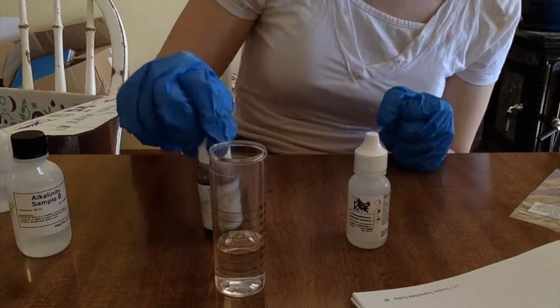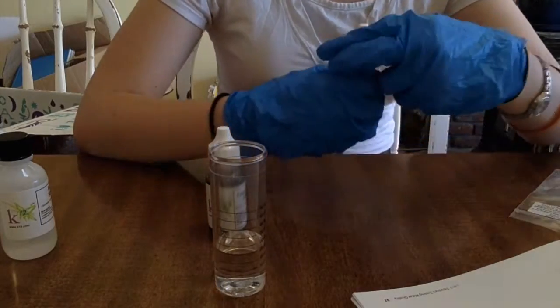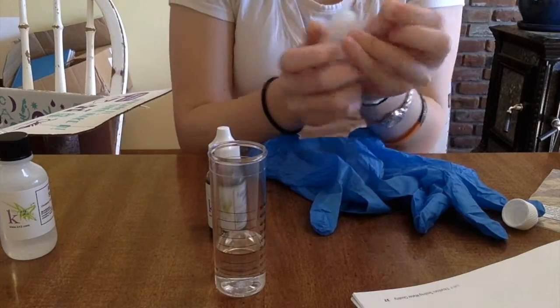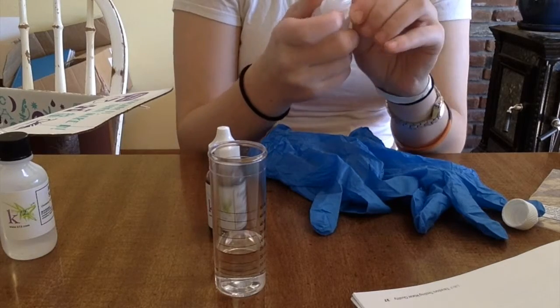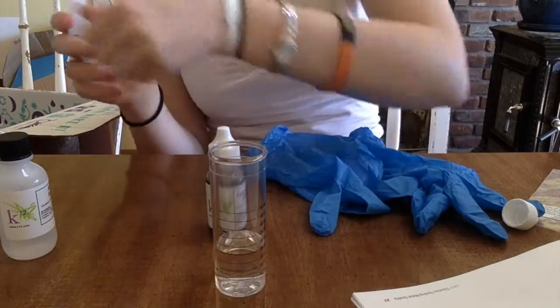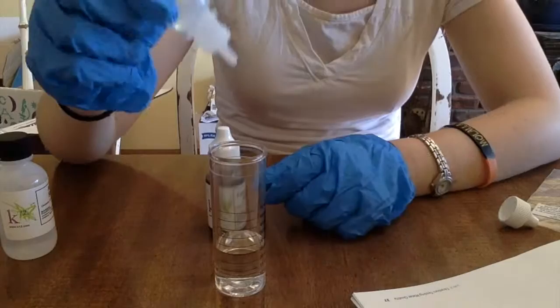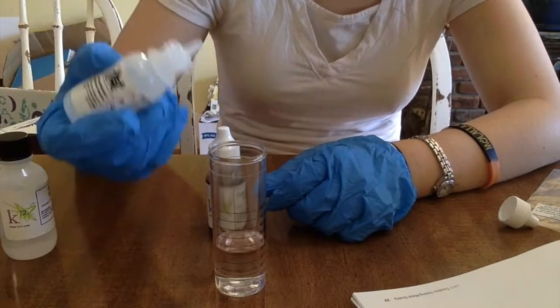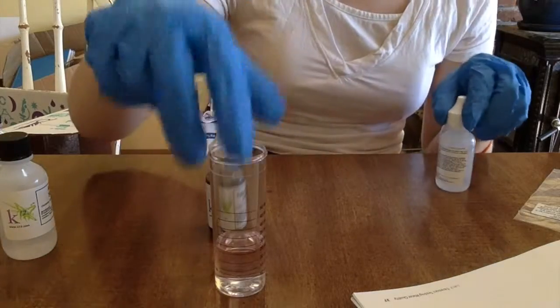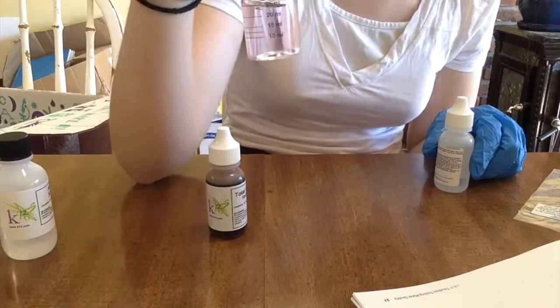Next step is three drops of the P indicator and then swirl to mix. I always get so nervous messing around with chemicals that I don't know. Every single little abrasion that happens to my skin, I'm always like, the chemicals, they're burning my skin, I'm gonna have to go and get it amputated. We need three drops: one, two, three. It is pink. It says to swirl to mix, it should turn and remain a pinkish red. That is just not as pink as it should be yet. That was three drops though. It is sort of pink.